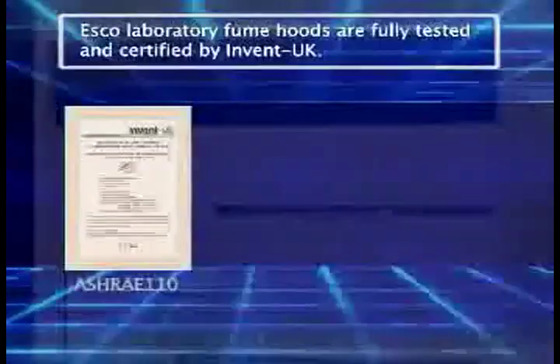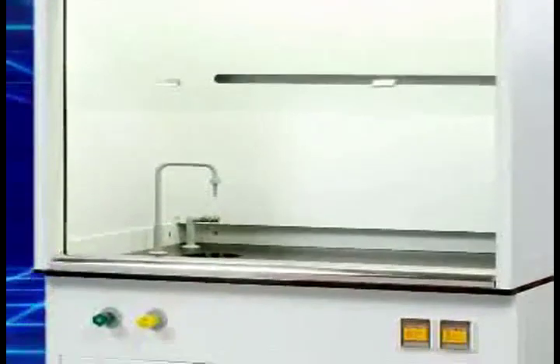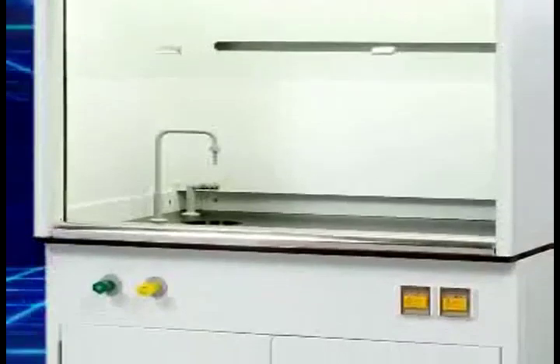At ESCO, we've passed more performance tests in more languages for more certifications throughout more countries than any other biosafety cabinet manufacturer in the world.